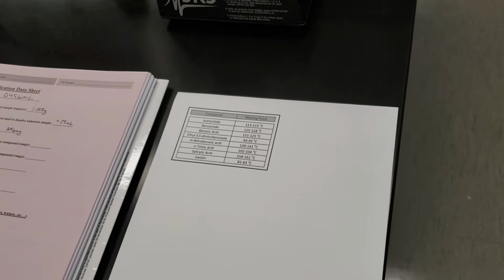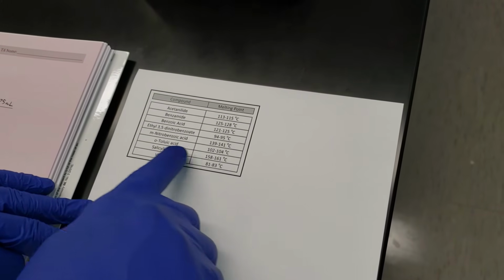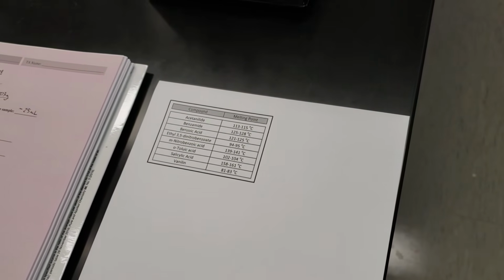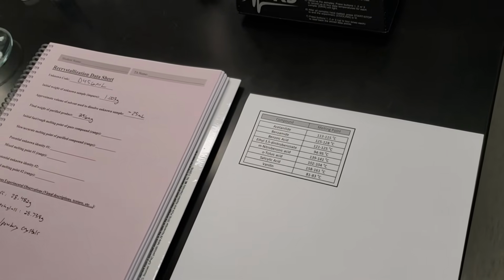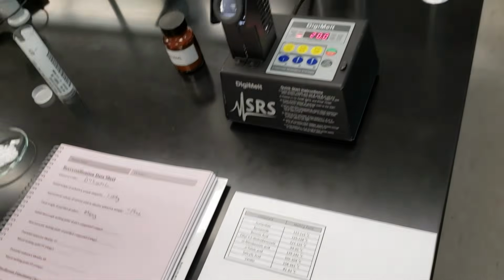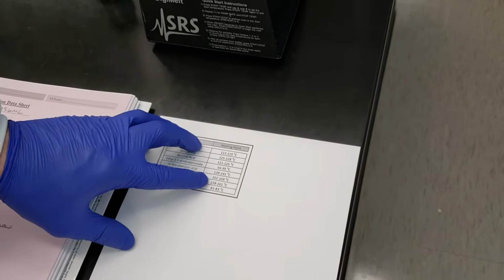Now this is a multi-point process. First thing that we're going to have to do, because we've got a wide range of possible melting points. We see our lowest is 81 to 83 for vanillin. Our highest is 158 to 161 for salicylic acid. So that's quite a range. So what we're going to do is we're going to do 2 melting point determinations for this unknown. The first is going to be a fast and inaccurate determination. We're going to be ramping the temperature up fairly quickly so we can tell where in that 80 or 81 to 161 range our compound melts.